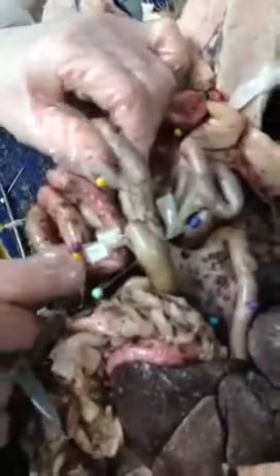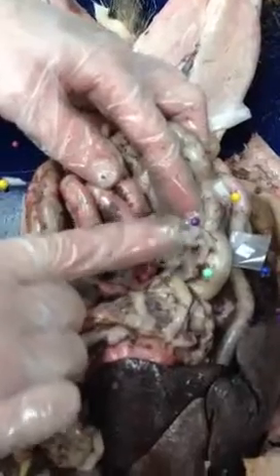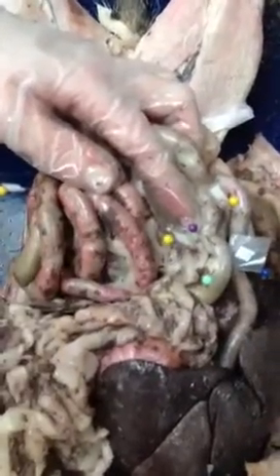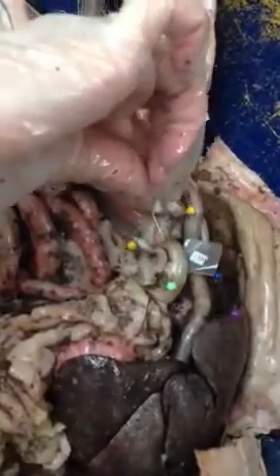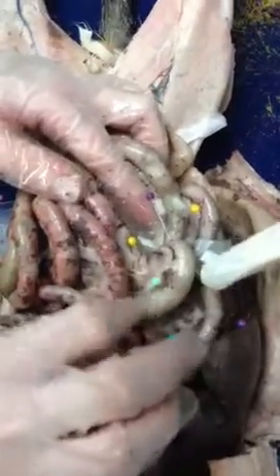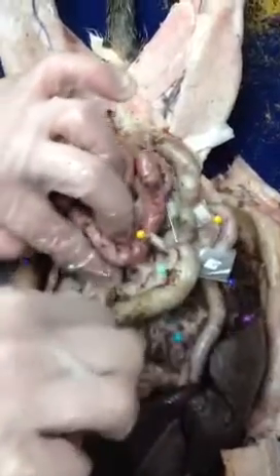All right, this yellow one is where the ileocecal valve would be pinned if we wanted that, even though it's inside. You can see it's right there. This one for the cecum would be more right at the edge. And that's the ascending colon.